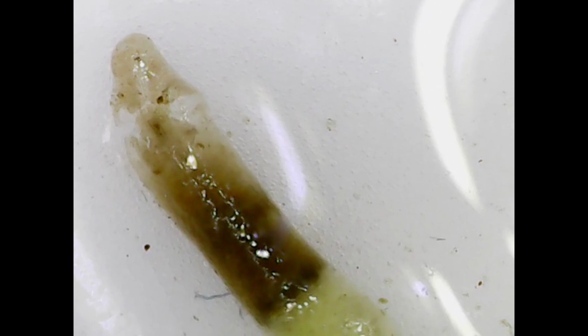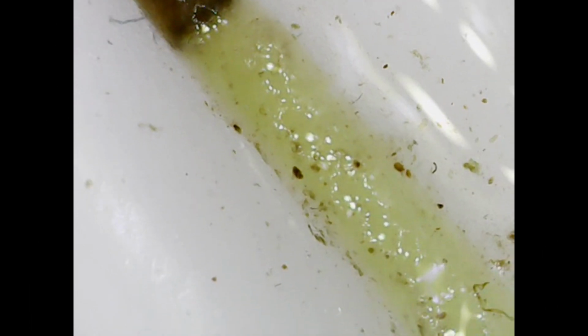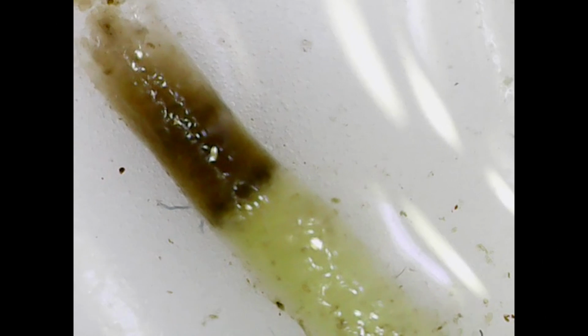Now we're getting into plant structures, if I'm not mistaken, and I'm going to start you off with the dreaded one that everybody hopes to never see on their plant. Let's have a look at the beginnings of root rot. Here you can see the tip of the root that has started to get some root rot. You can also see that lighter section of the root, which obviously does not have the root rot, but if left untended, that can start moving up the root itself, which is a shame, and you can see it's kind of deteriorating at the tip.